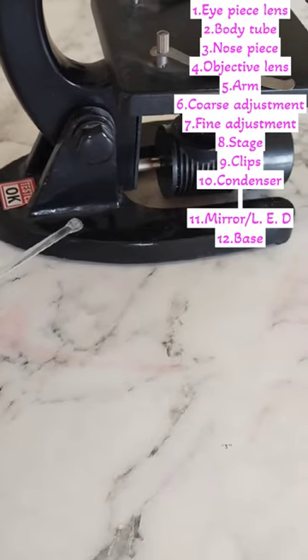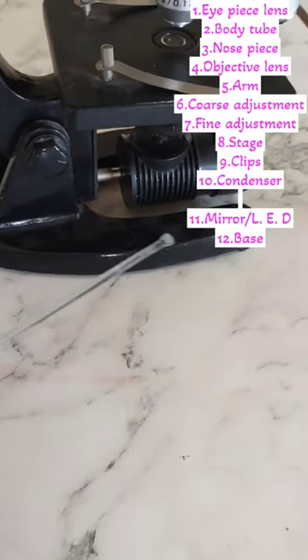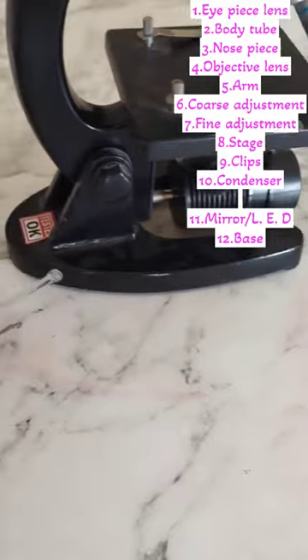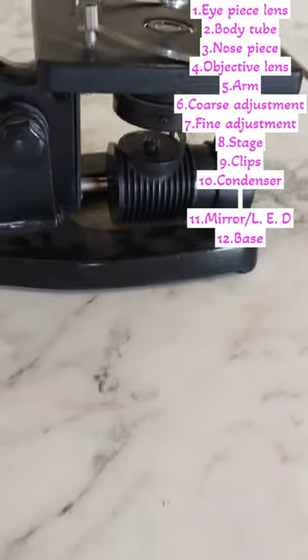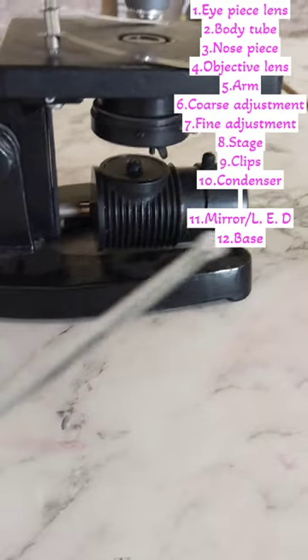You can see that there is a black circular structure known as the condenser. The condenser is used to focus the light onto the specimen.